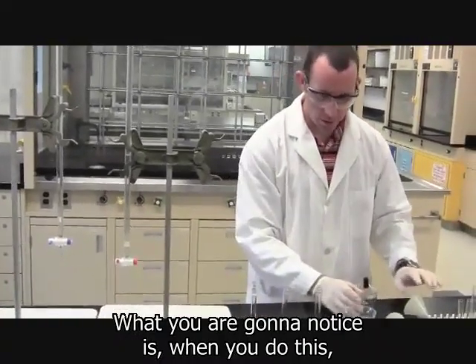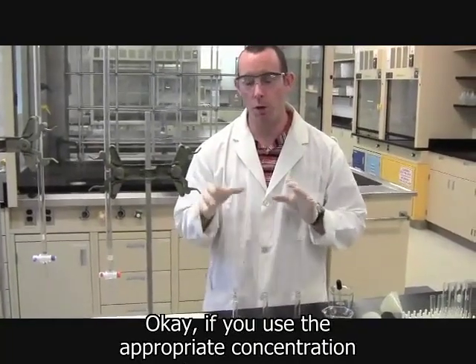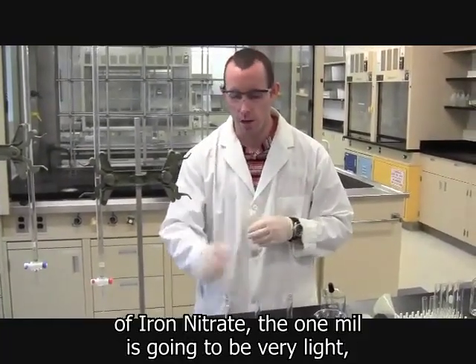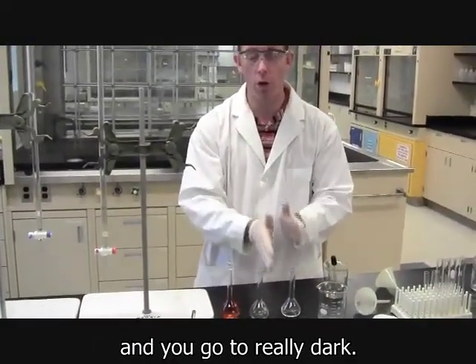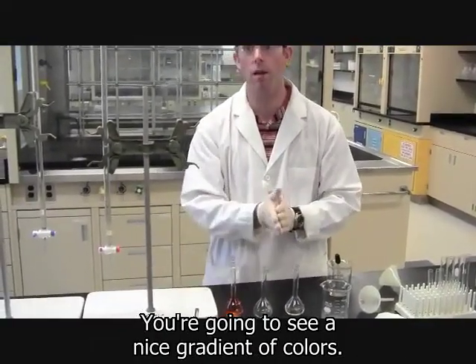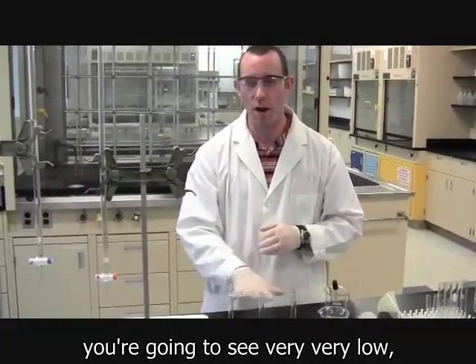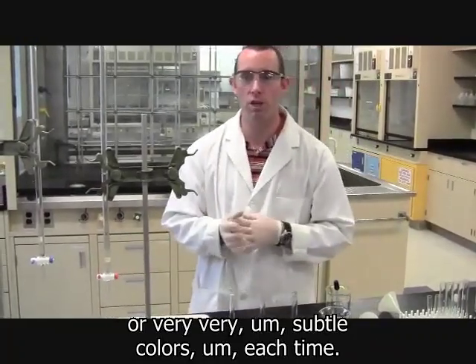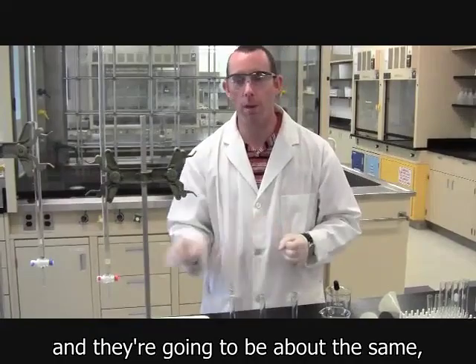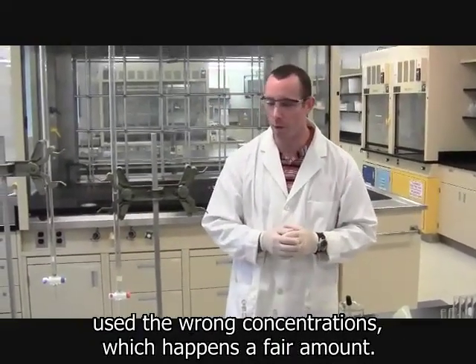What you're going to notice is, when you do this, you're going to get a very, very nice gradient. Okay? If you use the appropriate concentration of iron nitrate, the 1 mil is going to be very light, and you're going to go to fairly dark, and you go to really dark. You're going to see a nice gradient of colors. If you use the wrong concentration of iron nitrate, you're going to see very, very subtle colors each time, so they're not going to be very bright. They're going to be about the same. So that's a good indication that you may have used the wrong concentrations, which happens a fair amount.